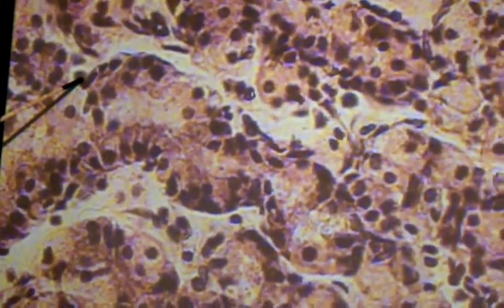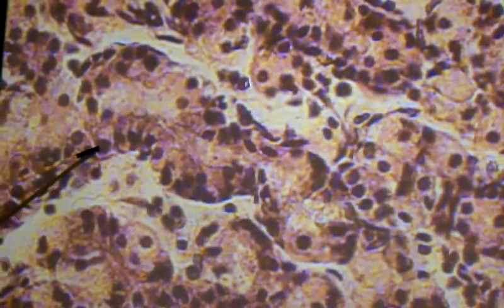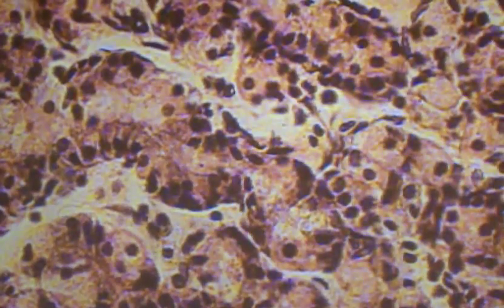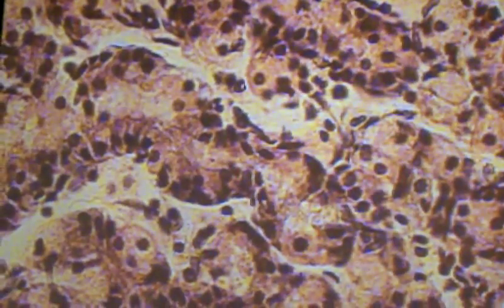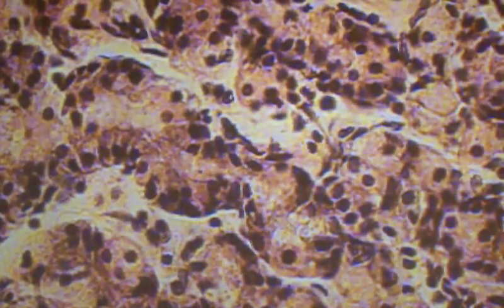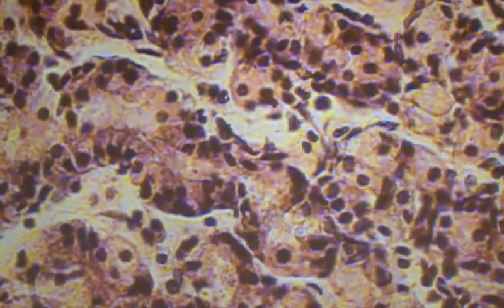Mixed in with these are the chief cells. They won't have a nice big cytoplasm around their nucleus, and they tend to be irregularly shaped as well. This cluster in here — these are all chief cells. In a really good slide, the cytoplasm you would see would still be grainy, but the shape of the cell would be irregular, and there wouldn't be very much cytoplasm in there.